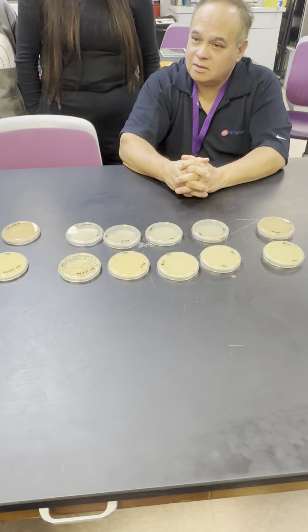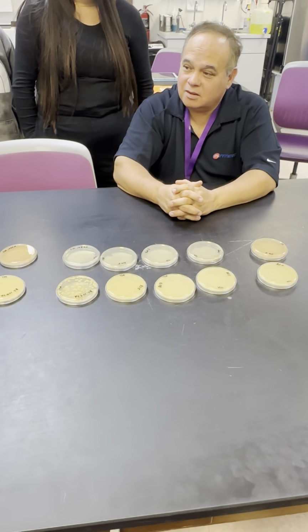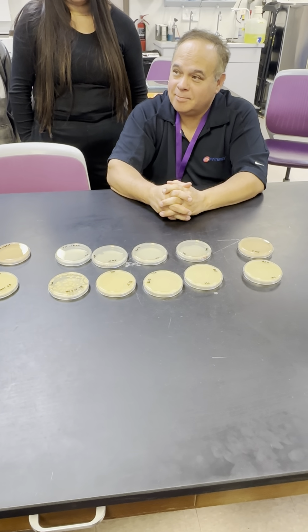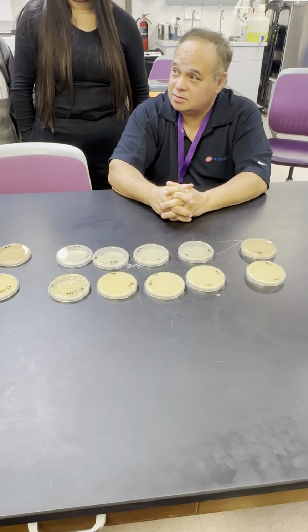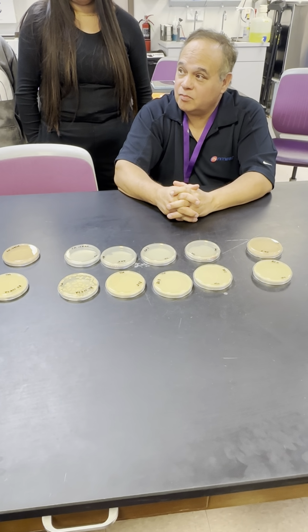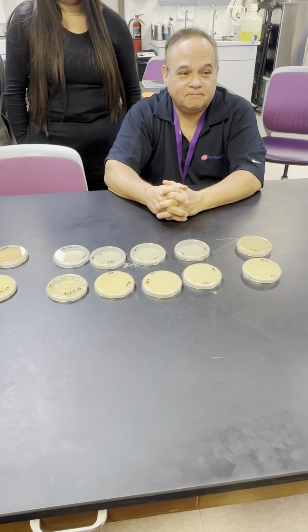Darn. I liked it and it grew. Yeah. Provide a hypothesis. Yes? We gotta think it through. You gotta think it through.